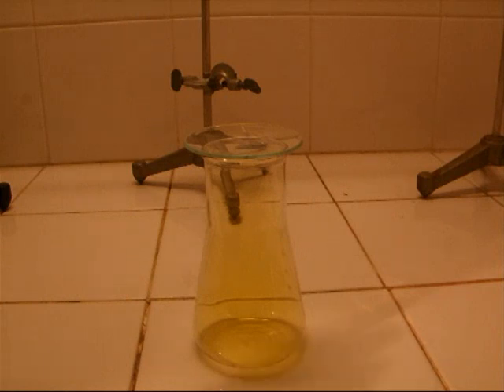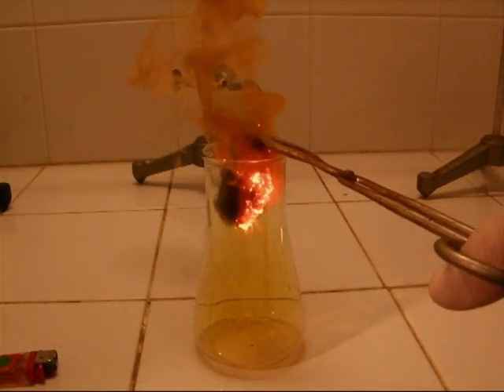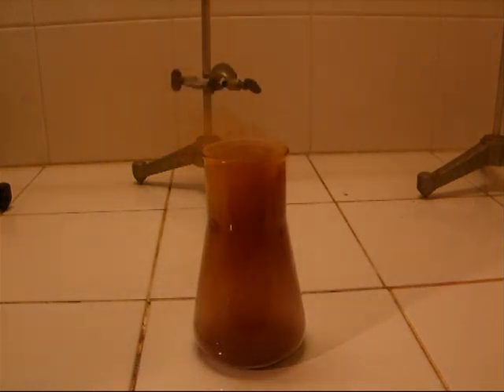Now to the first experiment. To show how reactive chlorine is, a piece of glowing iron wool is held into the Erlenmeyer flask. Immediately a violent reaction occurs. The iron and the chlorine are forming iron trichloride. It evaporates from the Erlenmeyer flask as a brownish gas.